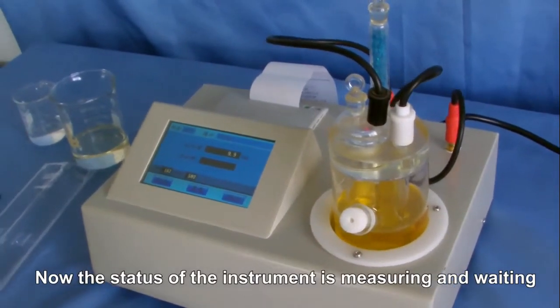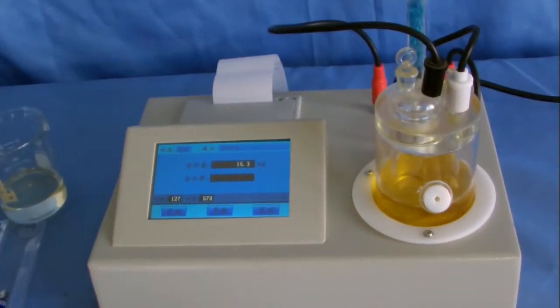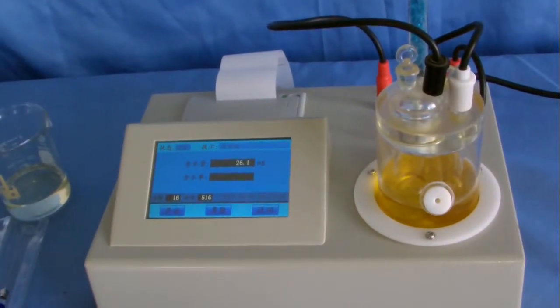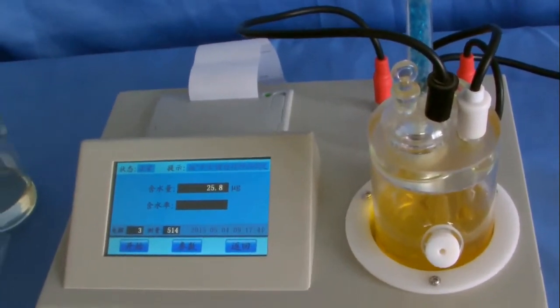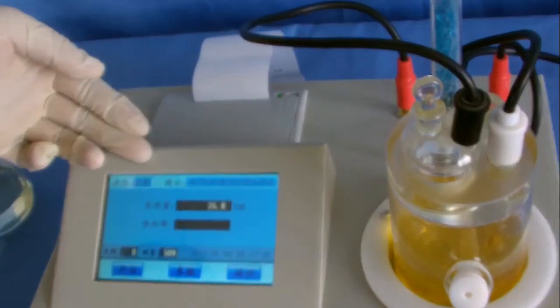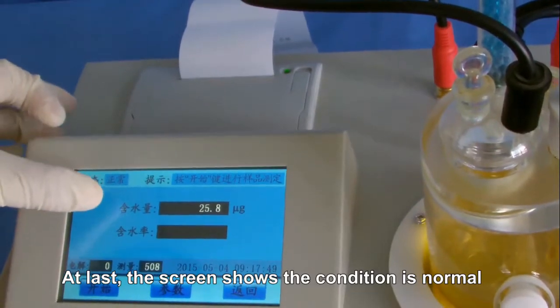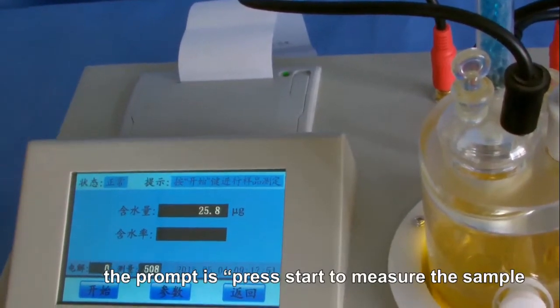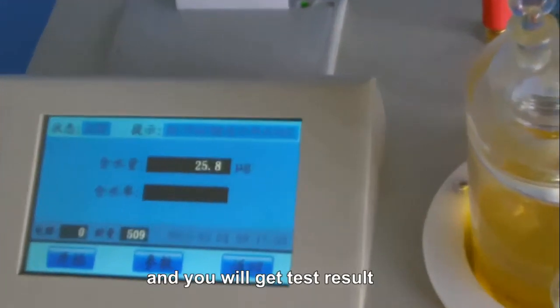Now the status of the instrument is measuring and waiting. At last the screen shows the condition is normal and the prompt is press start to measure the sample. And you'll get the test result.